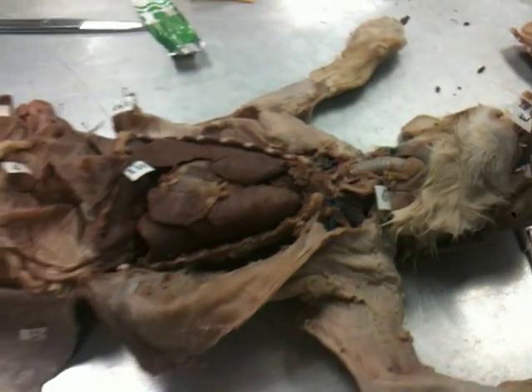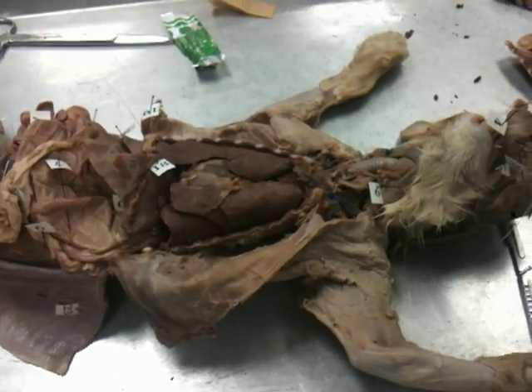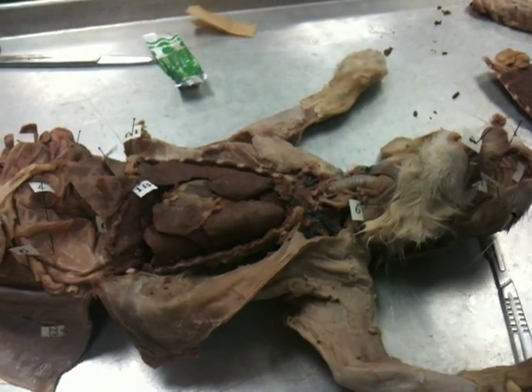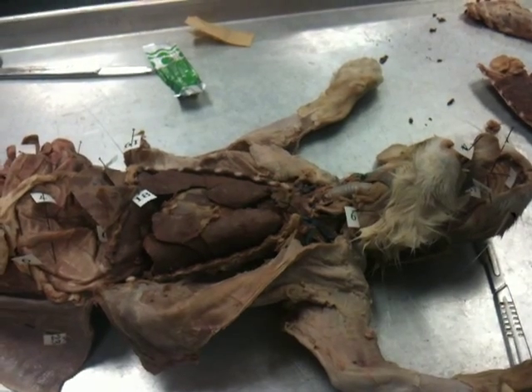I'm going to move it just a little bit, just so I can get this here. So do you want me to put it on a white tray after I'm done? And then you'll put the tray inside of the bag.